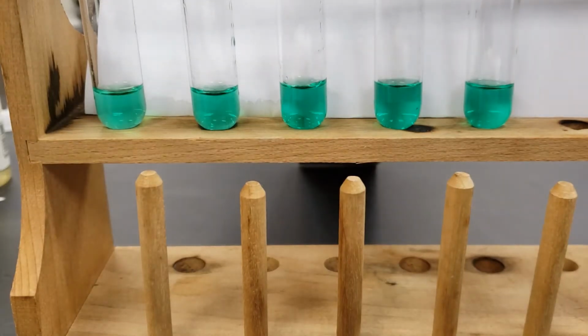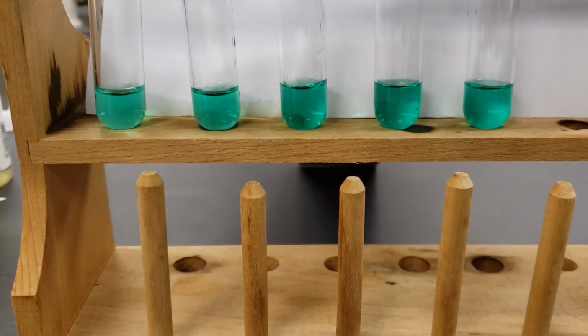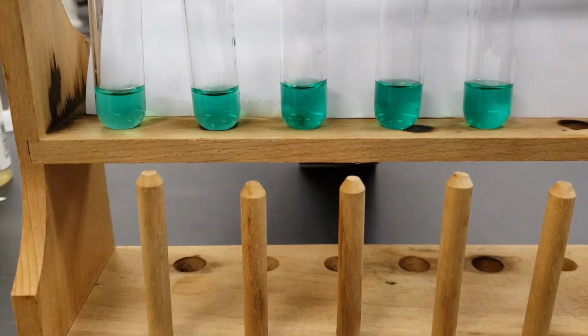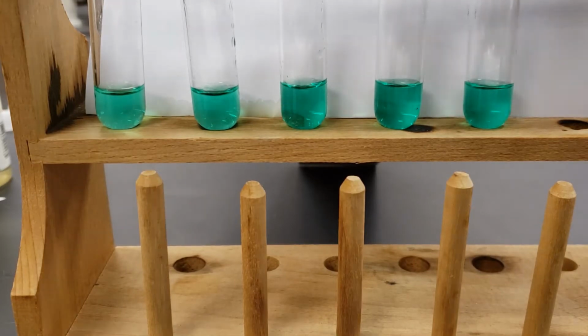All right, guys, here we're going to be doing the precipitation reactions. I'm going to be going through each of the groups and going through them in the same order that they are appearing in the lab. So right here we have 5 test tubes set up with the nickel 2 nitrate, and we're going to start in the first test tube, the one furthest to the left, by adding a few drops of the sodium hydroxide to this, and let's see what happens.